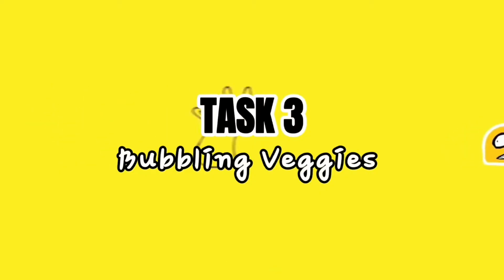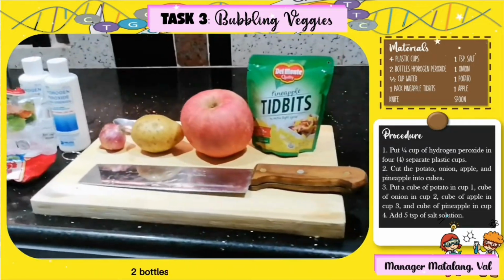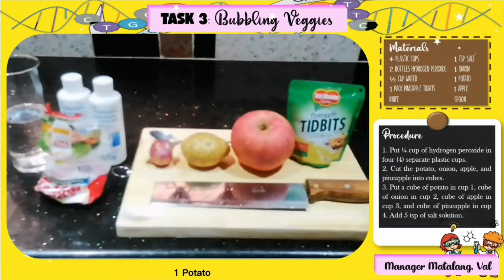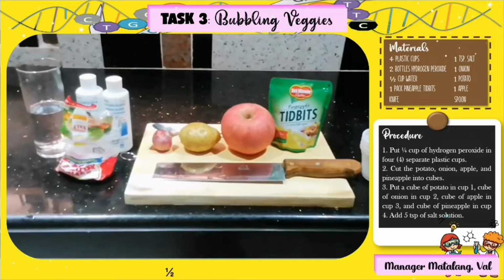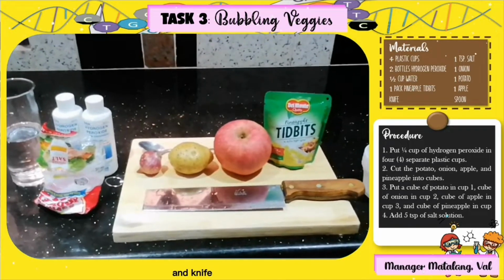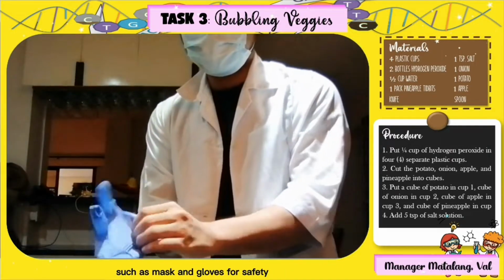Task 3. For this experiment, we will be using the following materials: 4 plastic cups, 2 bottles hydrogen peroxide, 1 potato, 1 onion, 1 apple, 1 pack pineapple tidbits, 1 teaspoon salt, 1/2 cup water, spoon, and knife. Make sure to wear personal protective equipment such as masks and gloves for safety.